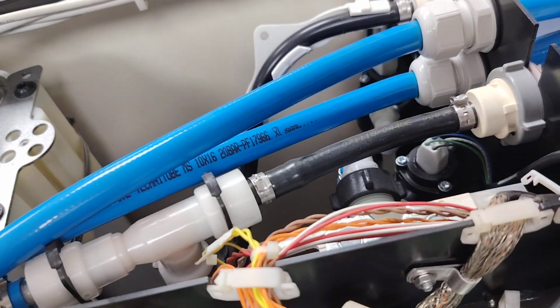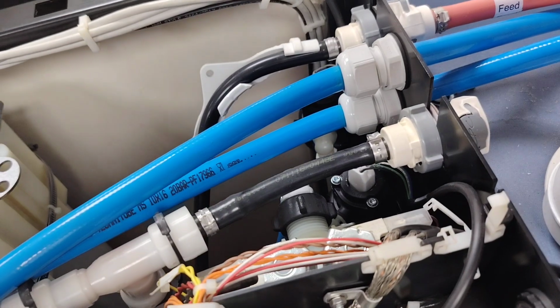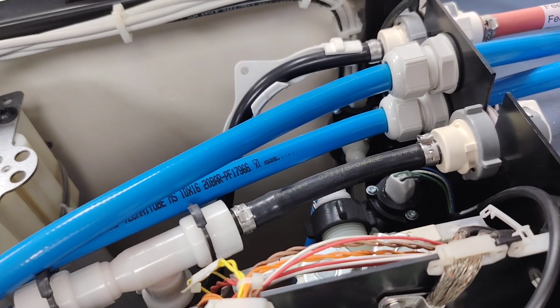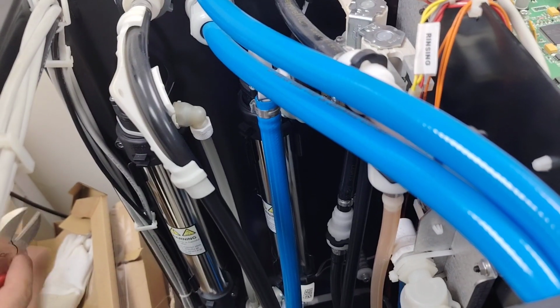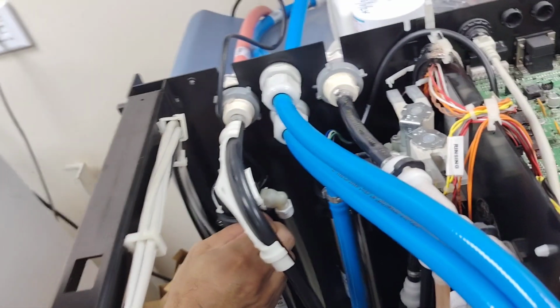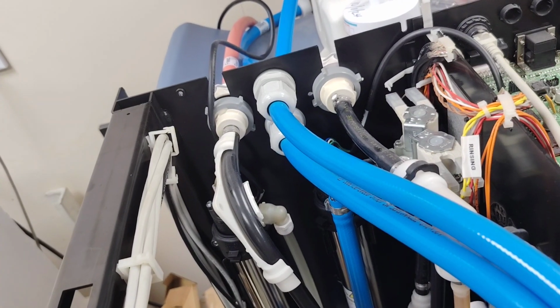This is, I think one of them was a surprise for you because they're different. I think you need to remove the cover on this side. This side has not been replaced, because this only comes from the factory. This is how you know it most likely hasn't been replaced.